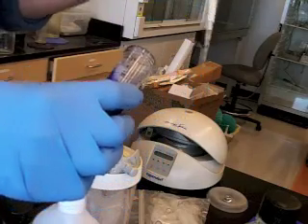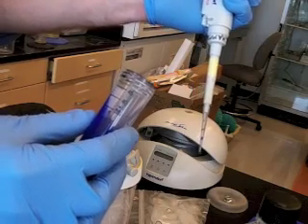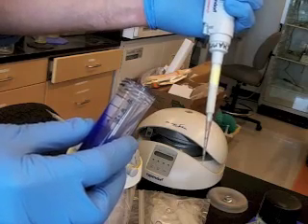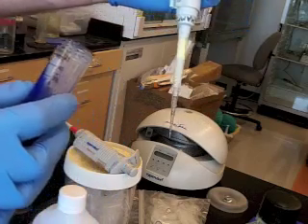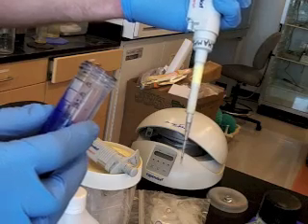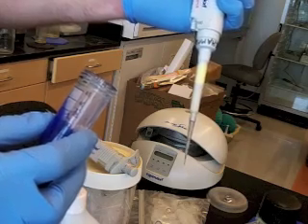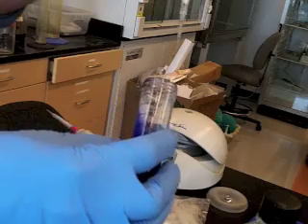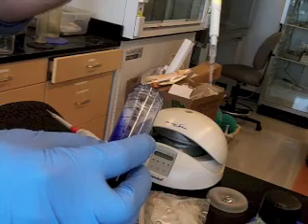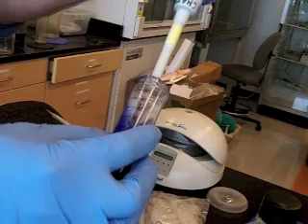And then when you push down on the button, you can push really hard, and it comes to a point where it won't move in any further. That's not how far you want to push when you're measuring the volume. There's a first stop, a gentle stop, and that's where you stop when you're going to measure. So the displacement between the rest and the first stop is the measured displacement that you're going to use. So the way to pipette is to get your bottle ready, and then before you put the tip in the liquid, you gently depress to the first stop, no further, hold it, and then you put just the tip in.